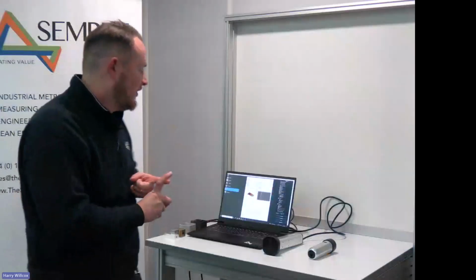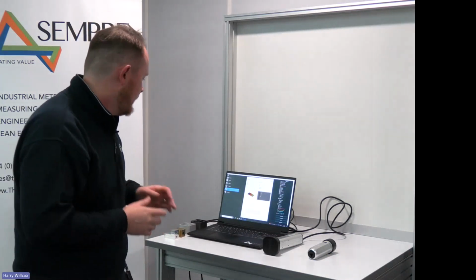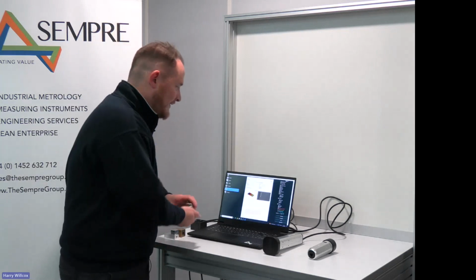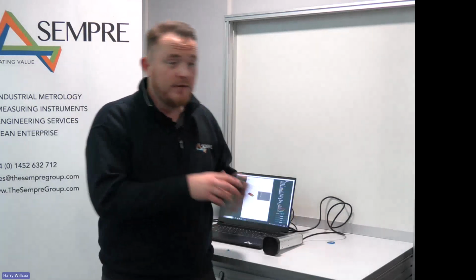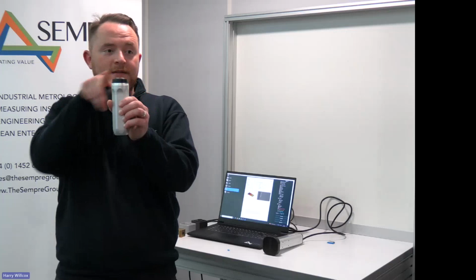We've got a high resolution set of data, and we're able to achieve a little bit more capability in the lower value of measurements that we take. So going to one of the questions related to access, if you had a convex shape, what would you be able to use the system for? It's a slightly subjective question because it depends which system. So what we have to do is calculate the effective radius that the system can reach.